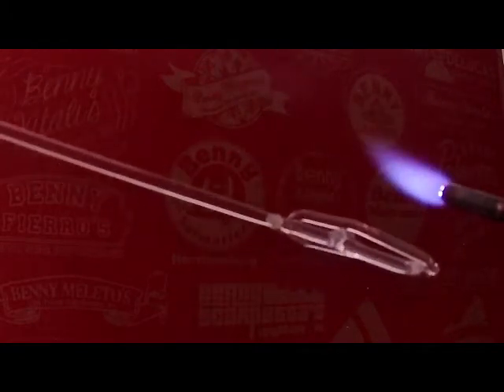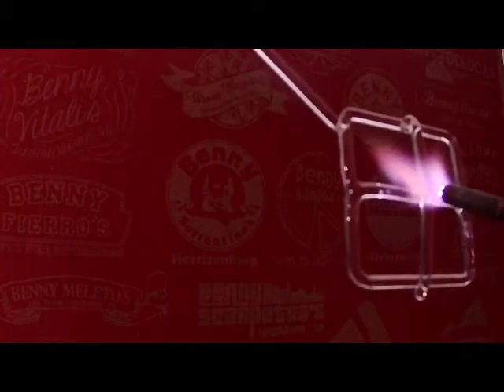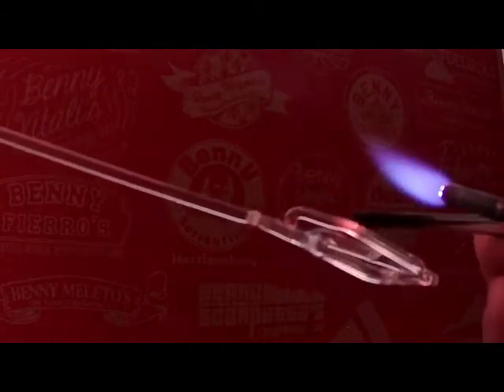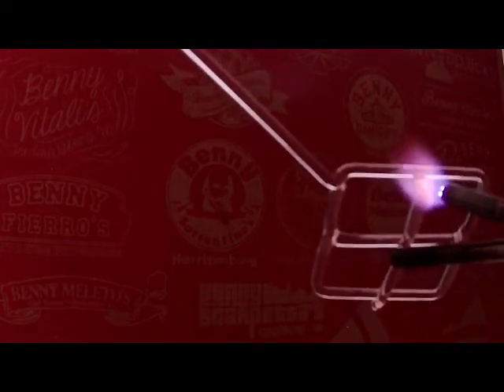Now, for this demo that I'm doing, I'm not concerned about it being perfectly centered or even perfectly planar. So what I'm going to do is I'm going to heat the top of that and then push it down a little bit. And you can see in doing that, I've made a pretty big divot. And now I'm going to soften up both ends and then push it down just a little bit more. Hopefully that'll help bring the two pieces of glass either in contact or very close to it. So as I'm heating here, give this a little push. Okay. And that moved it a little bit, not very much.